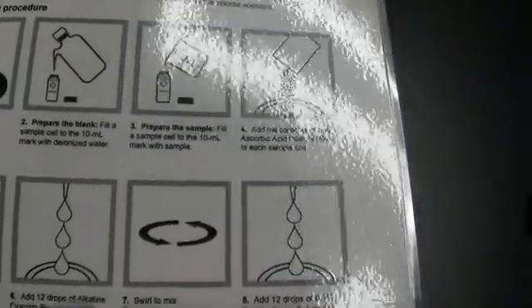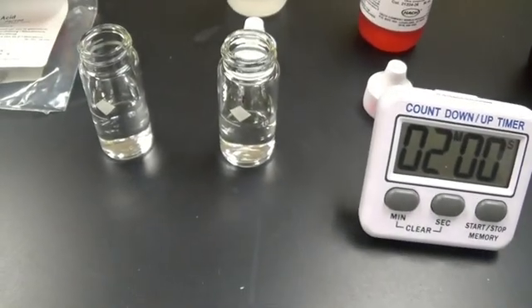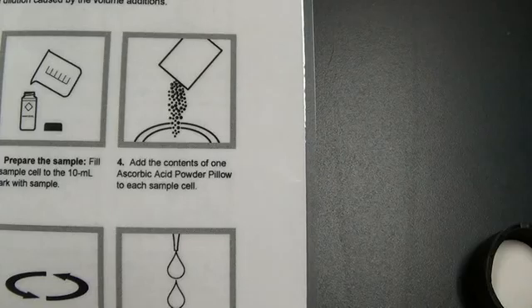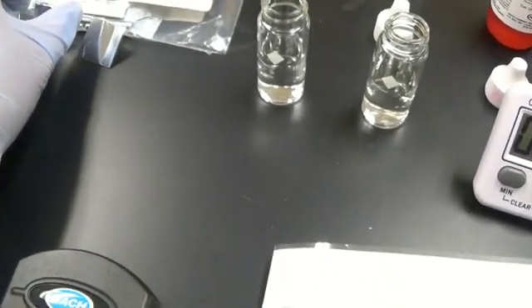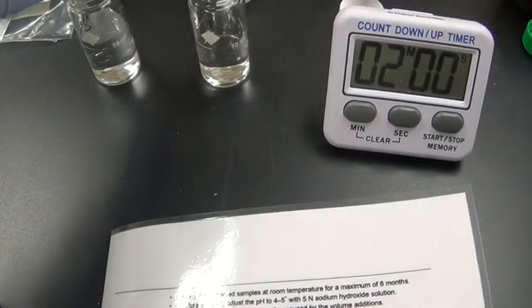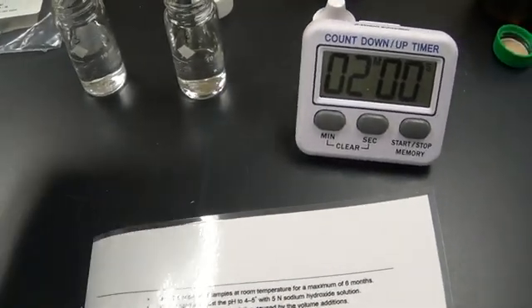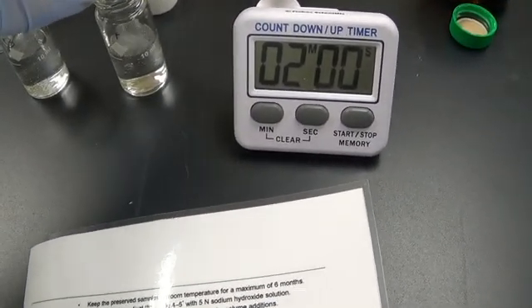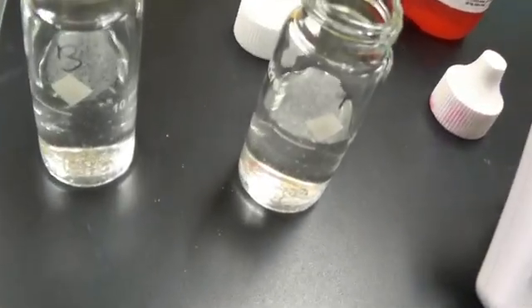Next, I fill the blank with 10 mils and the sample cell with 10 mils. Then I add the contents of one ascorbic acid powder to each of them, to the blank and to the test.